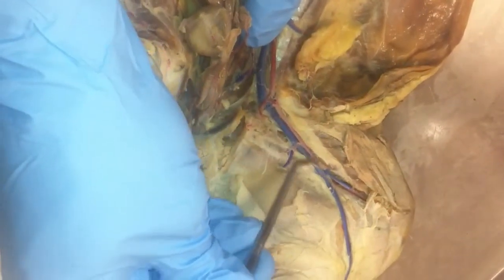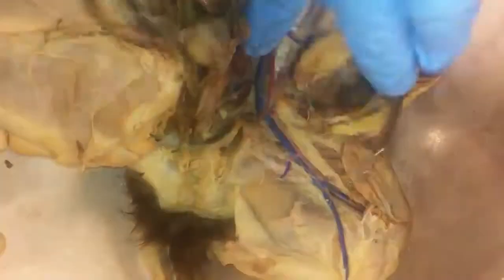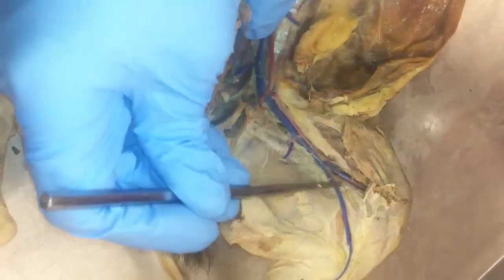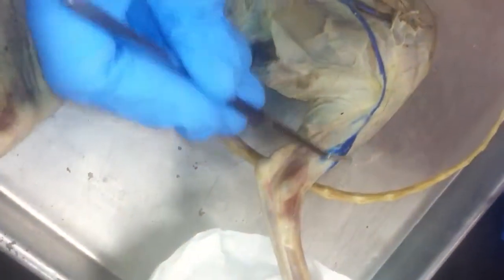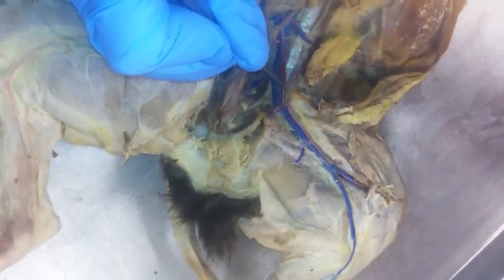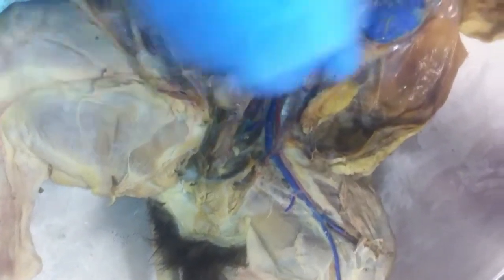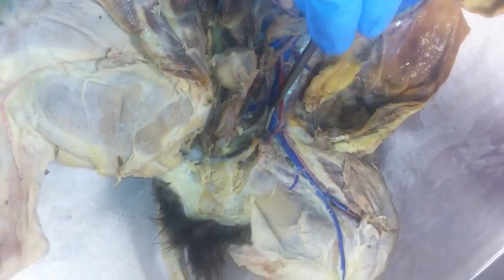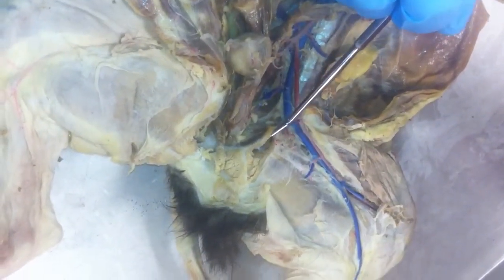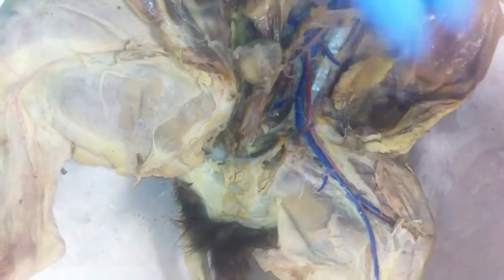Continuing on, we have the femoral vein and artery. Popliteal vein and artery go straight to the knee. Saphenous vein and artery continue on down the leg. Deep femorals in that. Deep femoral right here, coming off both the artery and the vein. Right when you get past this pit that's defined by the iliacs, then you have the deep femorals. And then femorals go that way.